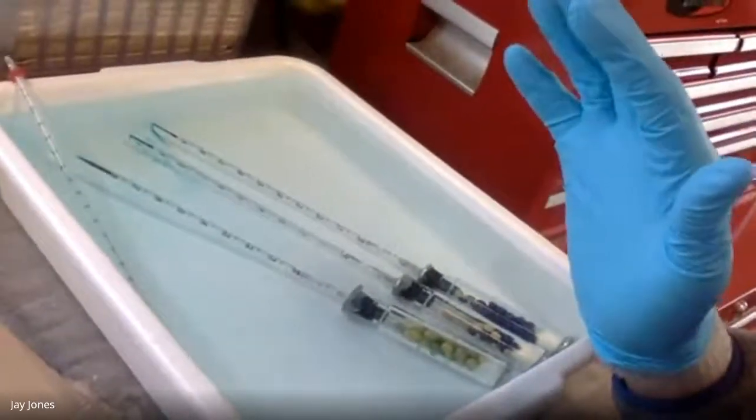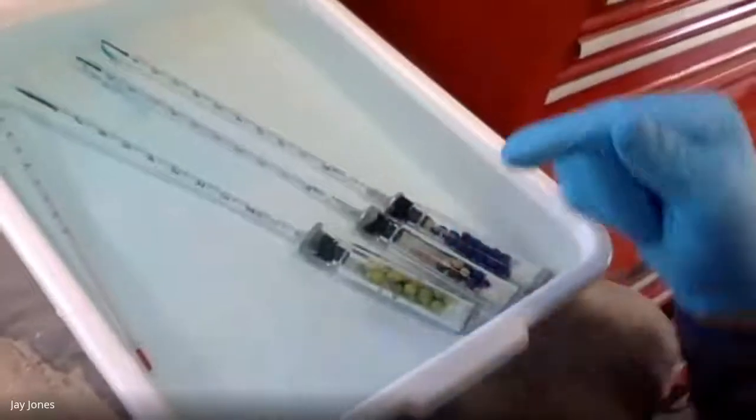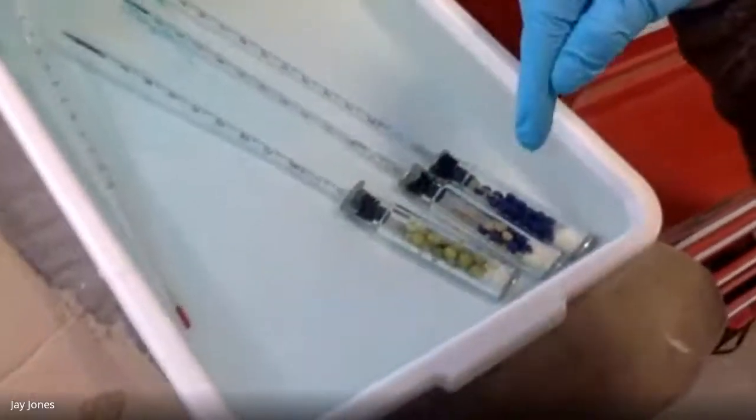And as you guys just said, I couldn't tell who said that, I'm sorry, because I'm just looking at this video, that blue beads only measures those changes in temperature and pressure.